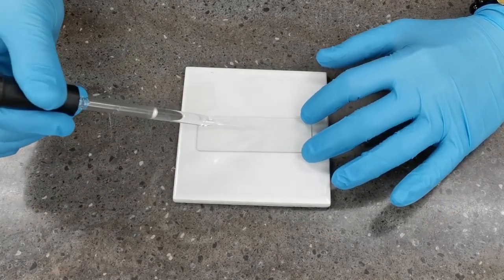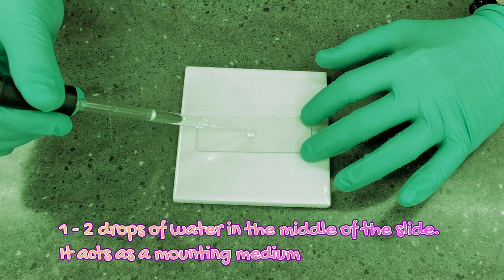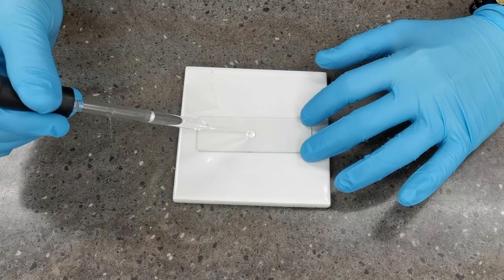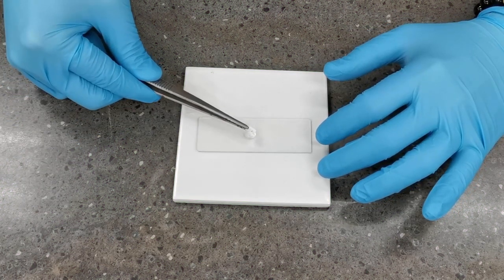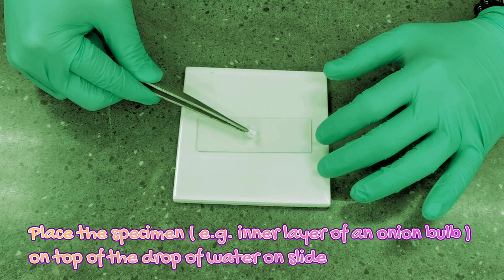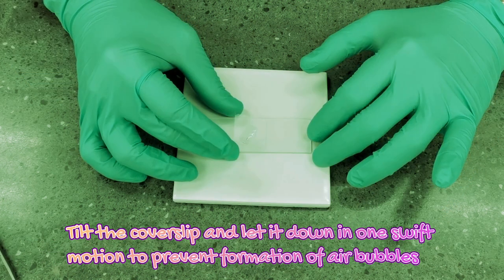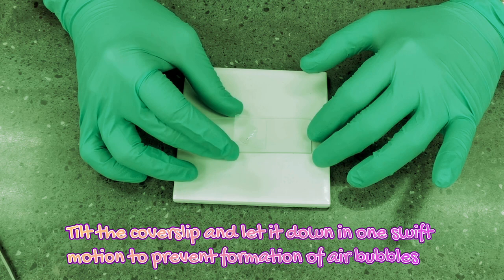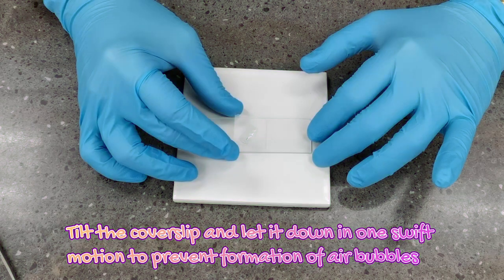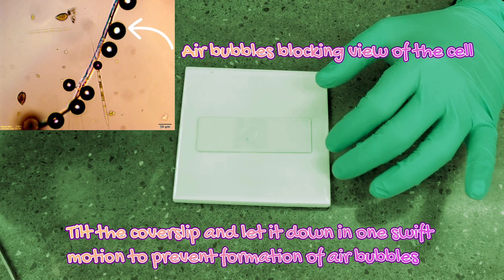First, you will introduce one to two drops of water in the middle of the slide and place the tissue on top of it. This keeps the tissue hydrated on the slide. Then you will place a cover slip, tilt it at a 45-degree angle, and swiftly let it down to avoid formation of air bubbles, which can interrupt the view of the cell.